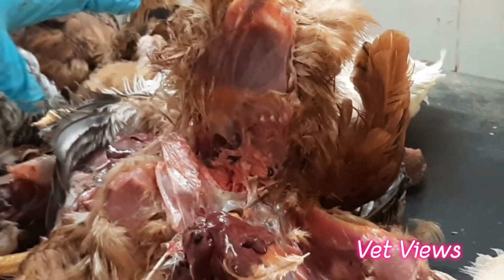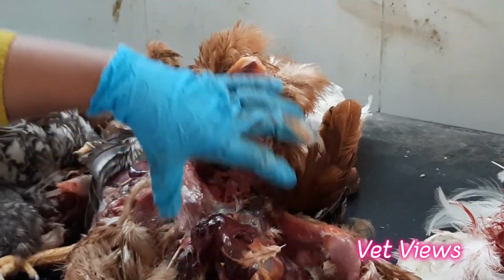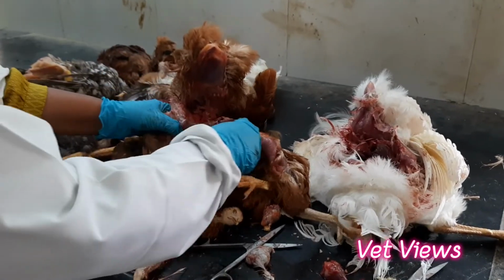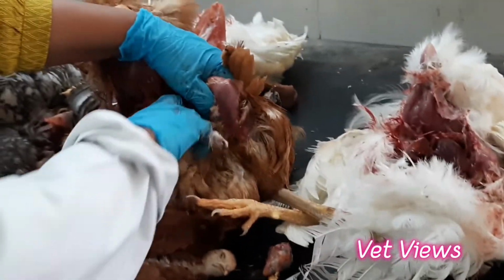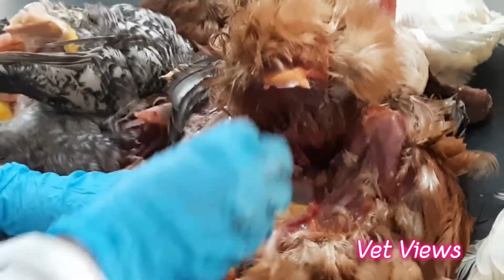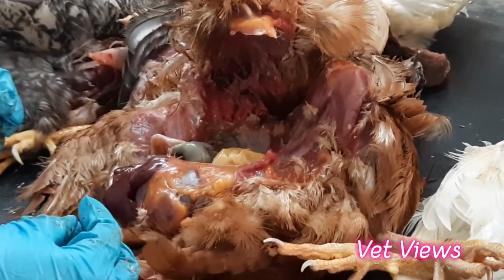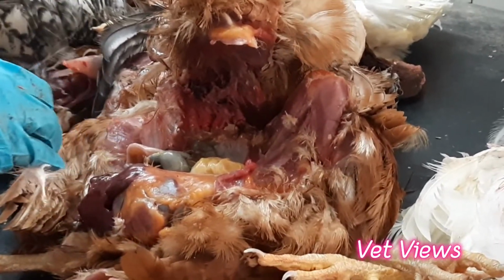In birds, there are three pairs of air sacs: clavicular air sacs, thoracic air sacs and abdominal air sacs. So there will be six. When you open it, they become torn off. Generally it will be this size. In air sacs, what you have to observe is, in case of CRD, in case of mycoplasmal infection, it becomes yellow, like egg yolk. You will feel like egg yolk kind of thing accumulated in the air sac. That is a lot of pus, pus material accumulating in the air sacs because of the mycoplasma infection. That's a very common condition we will observe. Today we don't have that case, otherwise we generally find that kind of case.